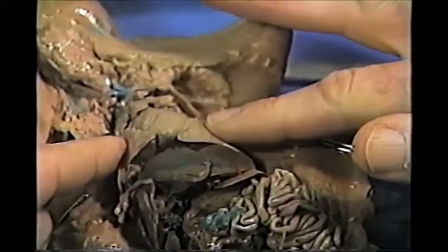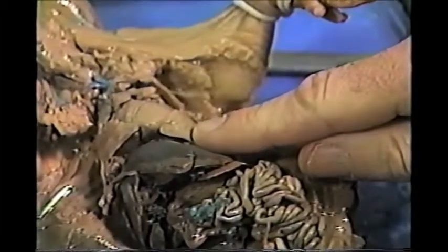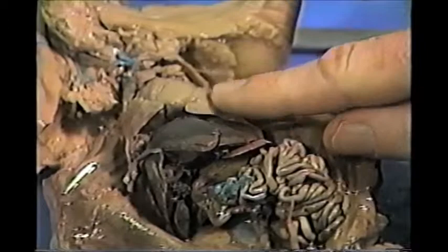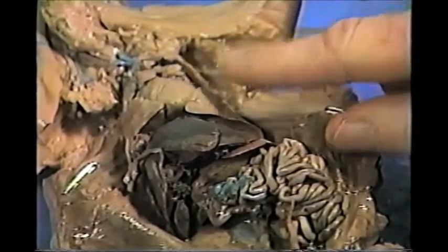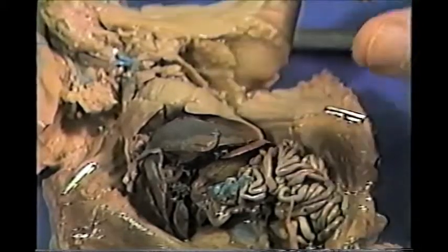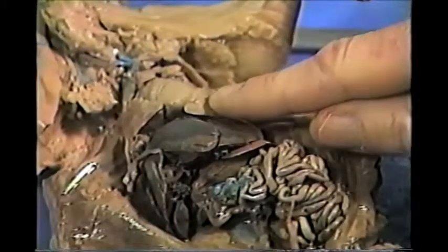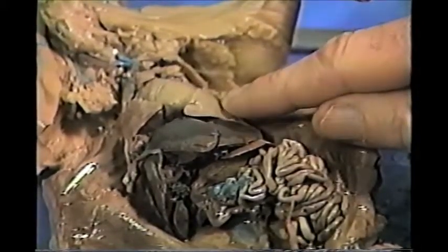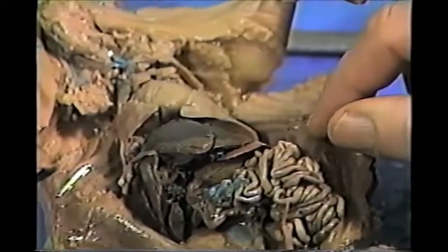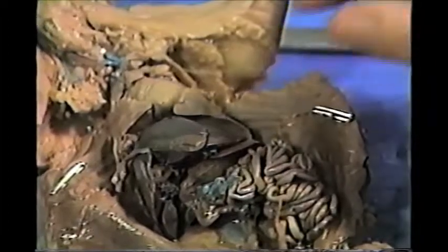Then you might have seen some bubbling coming out of the lungs because the little tiny air sacs, the alveoli, are permeable to air, and they go right through the alveoli and out. Now, in a living pig or human, there'd be blood vessels all around those little air sacs that would pick up the oxygen. I'm going to try one more thing and see if it works.